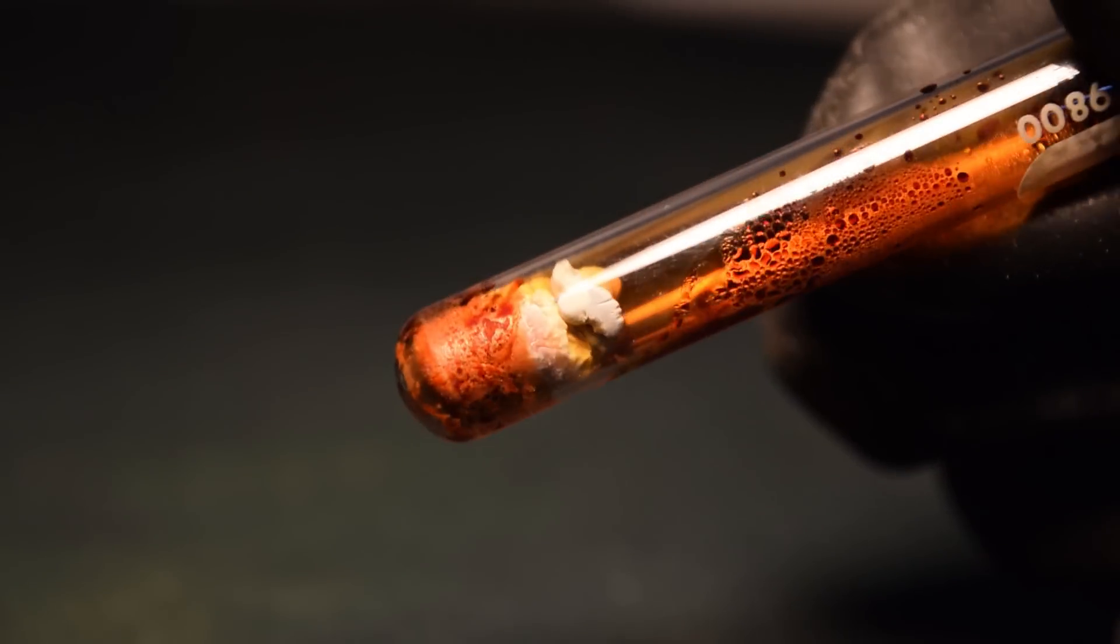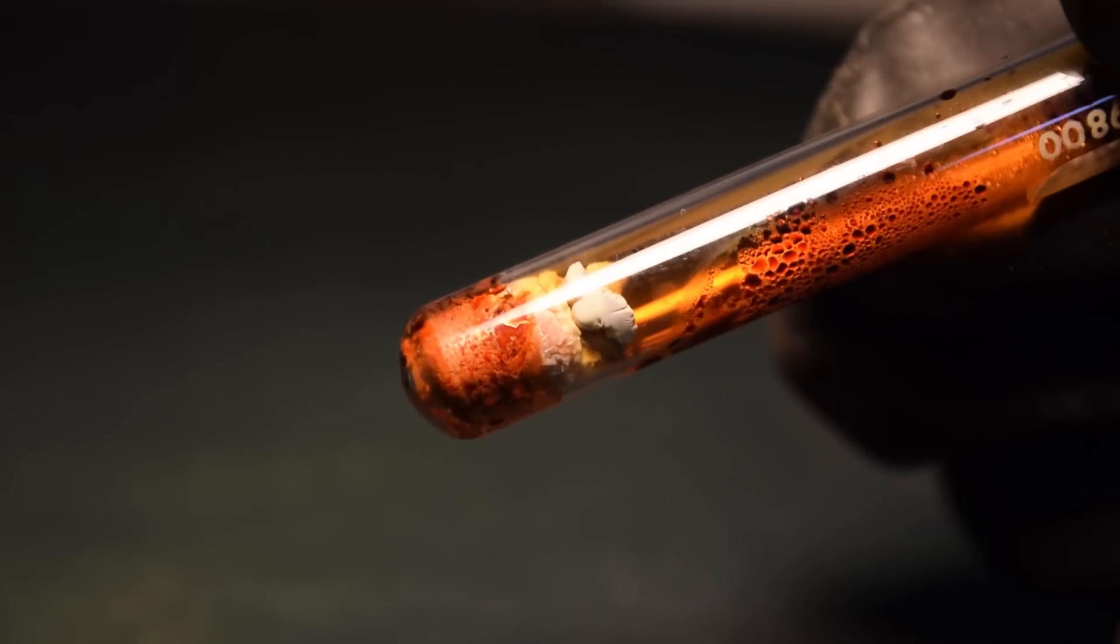Okay, it's finished, and as you can see, a white solid has formed in the bottom. This is mercury-1-bromide.